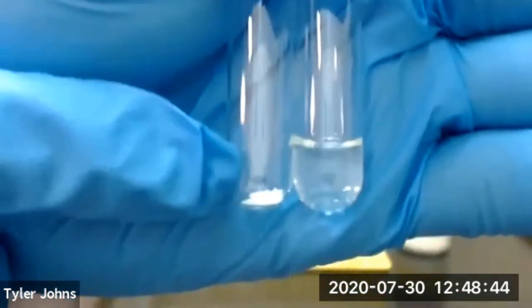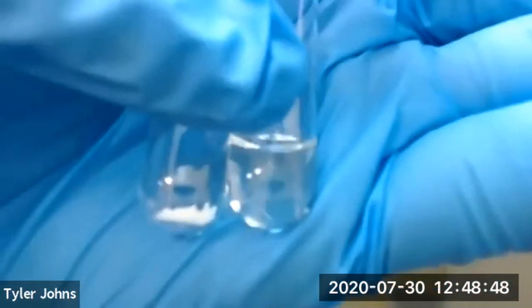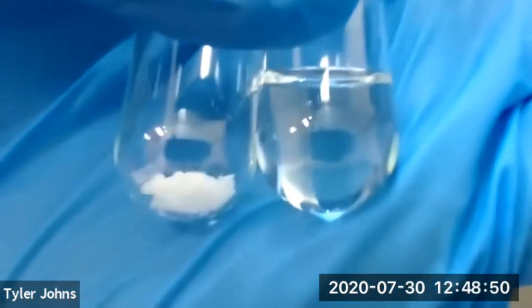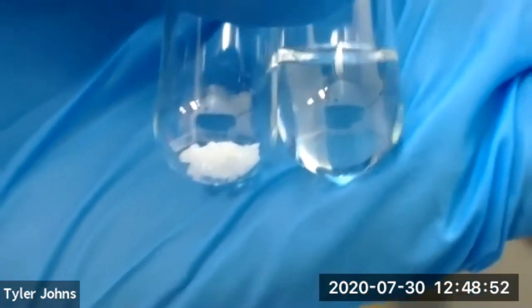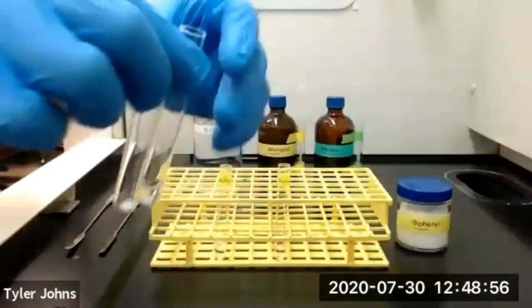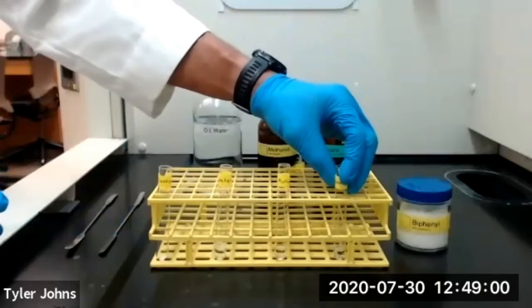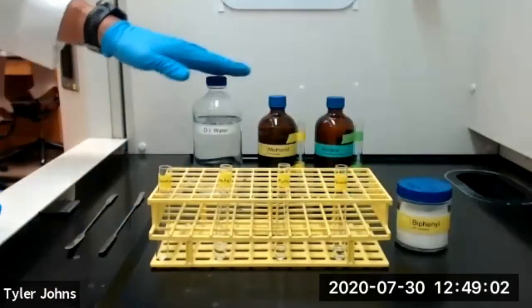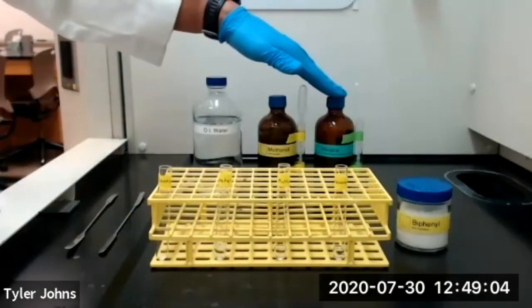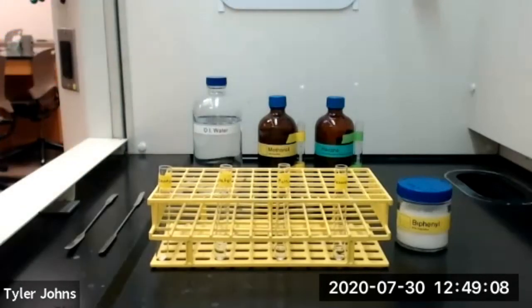So we have our control here and our test tube with our biphenyl and the hexane. Okay, you should now be able to draw conclusions about the solubility of biphenyl in our deionized water, our methanol, and our hexane. This concludes part A of this experiment.